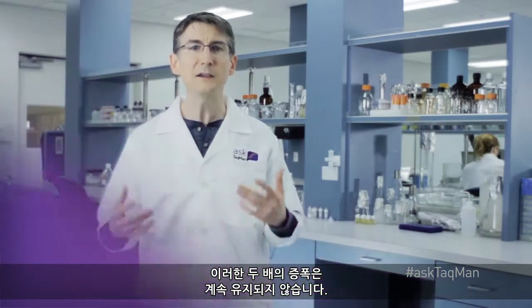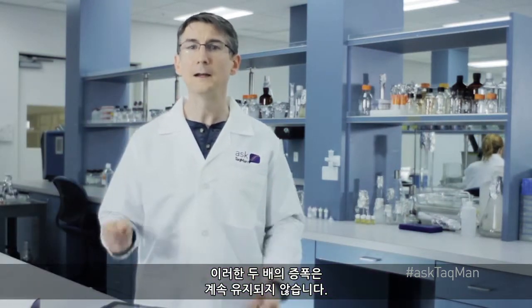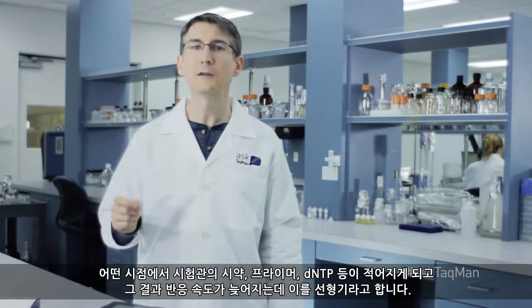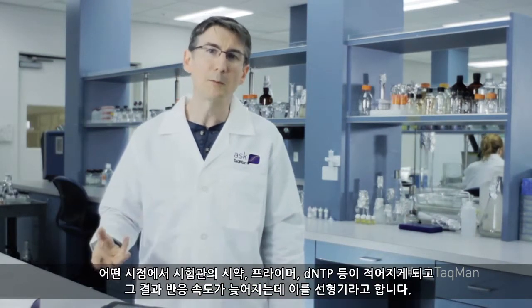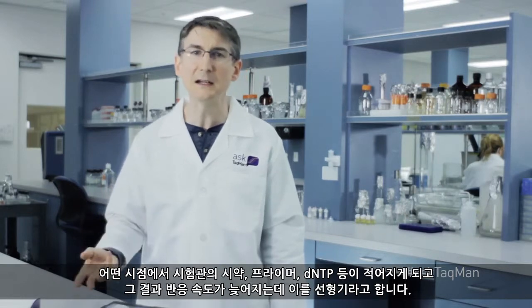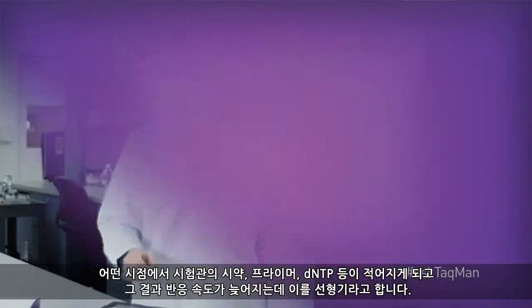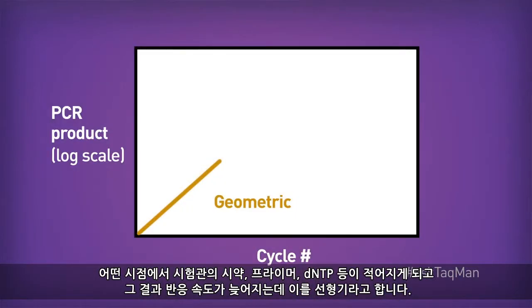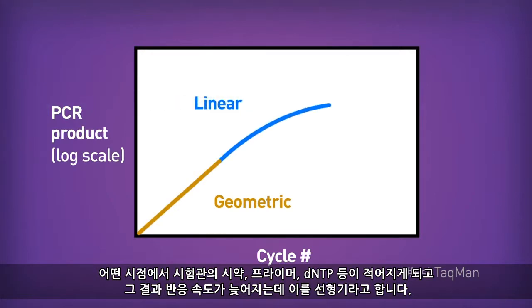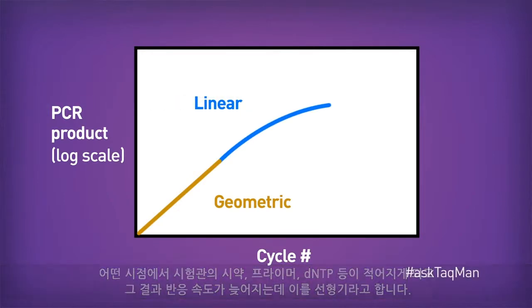Unfortunately, this doubling doesn't go on forever. At some point, the reagents in the tube — primers, dNTPs, and so on — start to run low. As a result, the reaction slows down. We call this the linear phase.